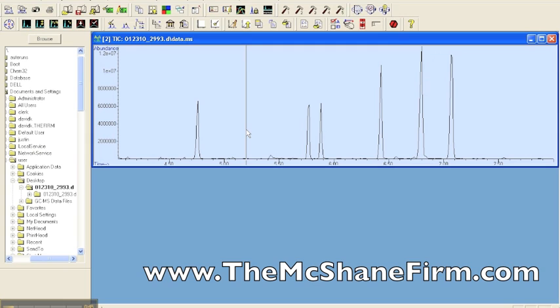That's the total ion current chromatogram. Here are the peaks that are the analyte of interest, done through chromatography. And if the chromatography was good and there were no co-eluting peaks, then we would expect the same result anywhere that we click, because what one has to do is right double-click on this peak in order to pull up a scan that's down below. That's the way this system works.